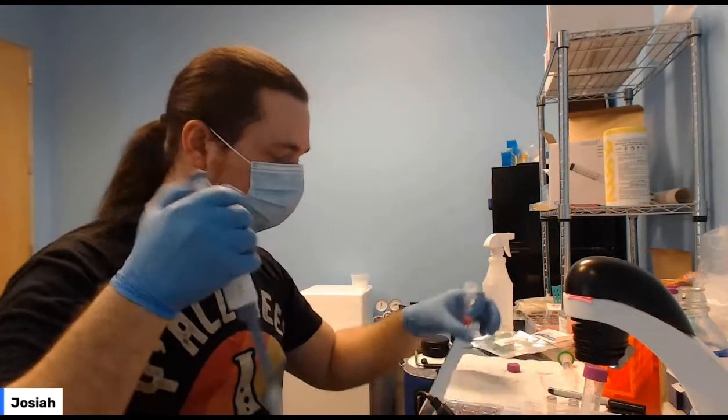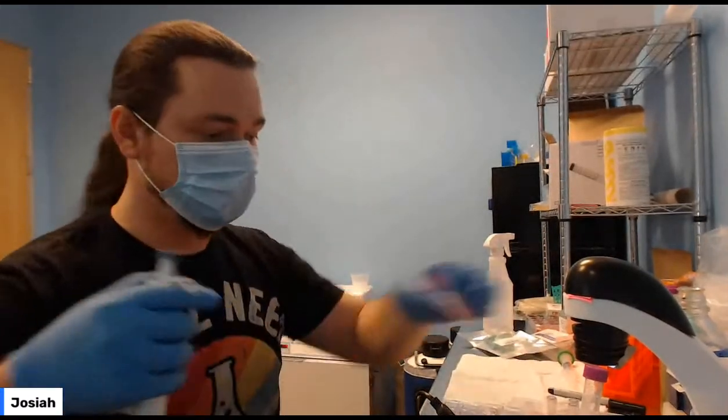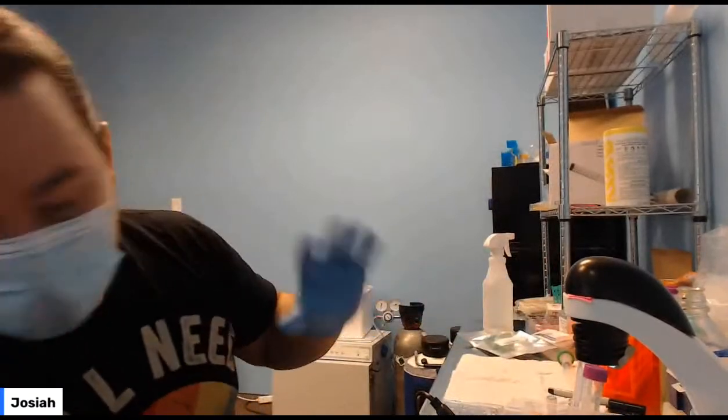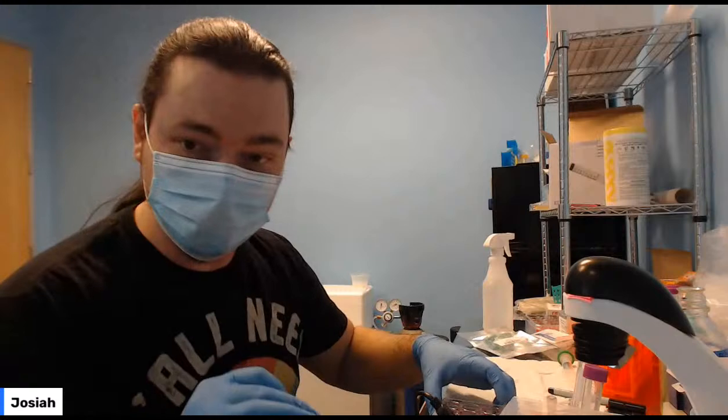But okay, so we've changed media in all of those wells. That's the first step to the transformation. So first step to transfecting these cells, change the media in the wells.